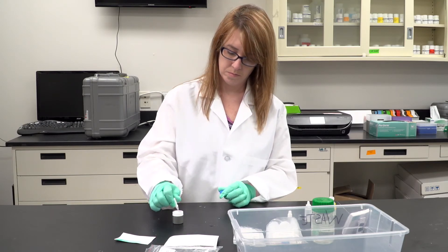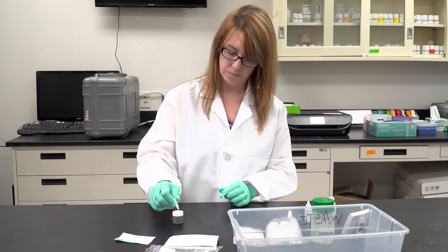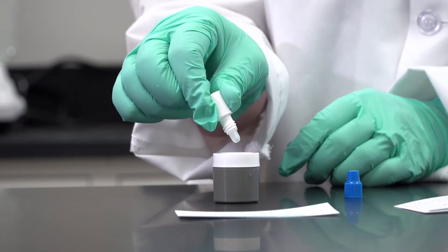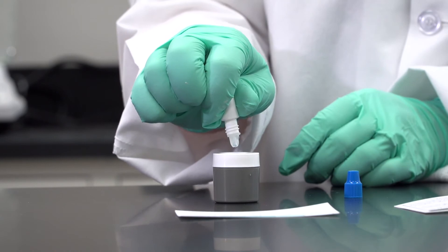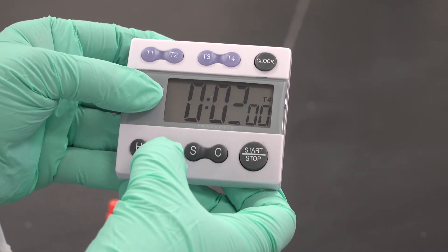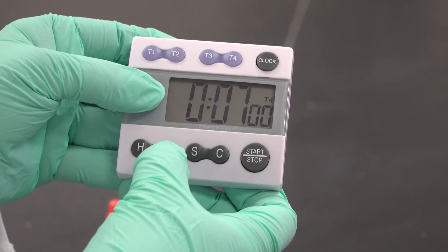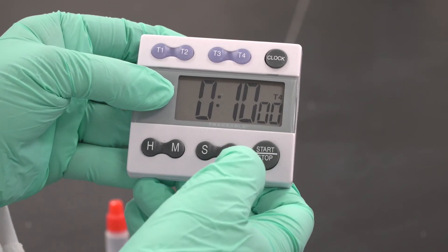60 to 69 degrees Fahrenheit, 15-minute incubation. 70 to 79 degrees Fahrenheit, 10-minute incubation. 80 to 89 degrees Fahrenheit, 8-minute incubation. 90 to 100 degrees Fahrenheit, 6-minute incubation.